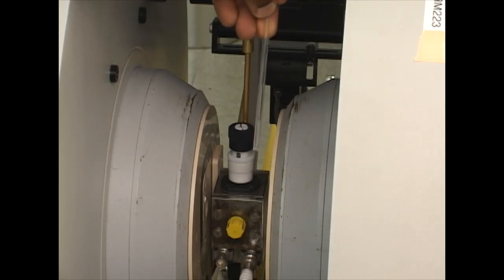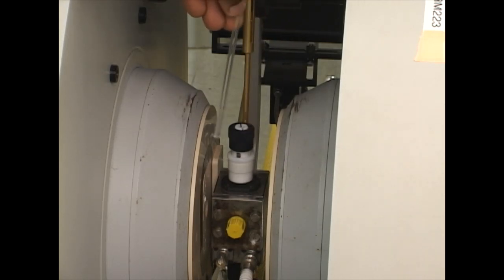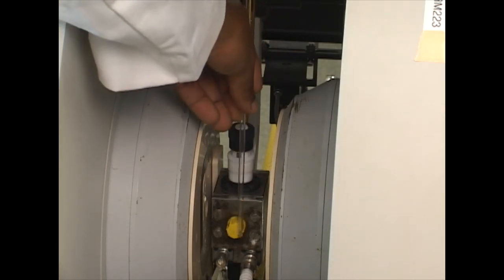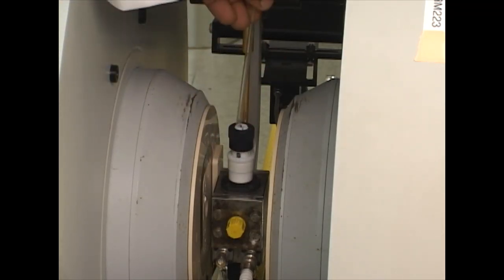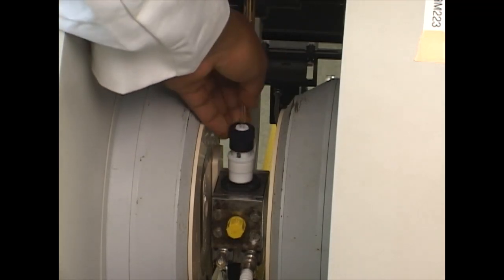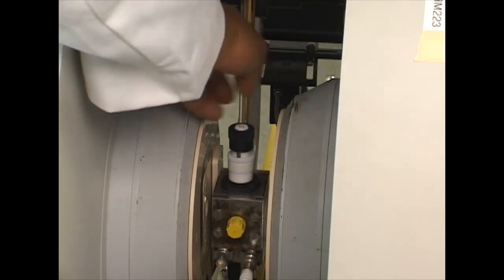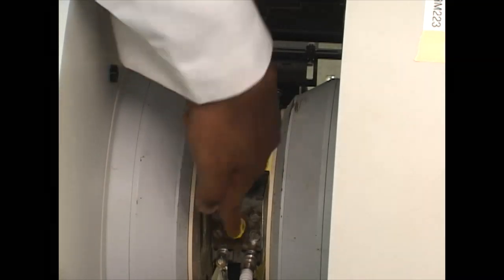We get a visualization of how far down the tube needs to go to align with the yellow spot. We measure exactly how far the sample needs to go down. Once we have that visualization, we can put our sample in the cavity and it should be at the correct spot.